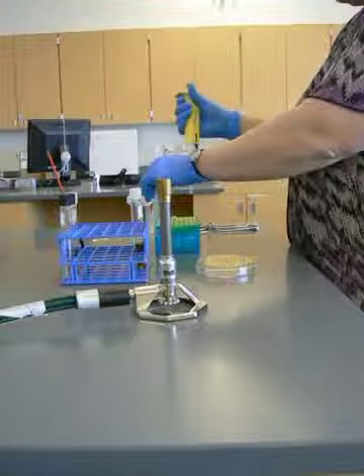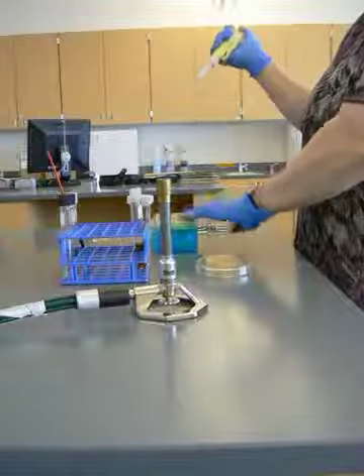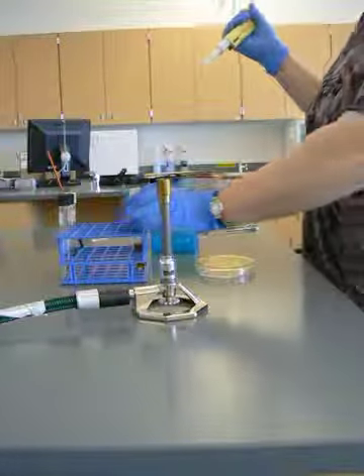So first thing that I'm going to do, I'm going to come in here and I'm going to get my pipette tip.